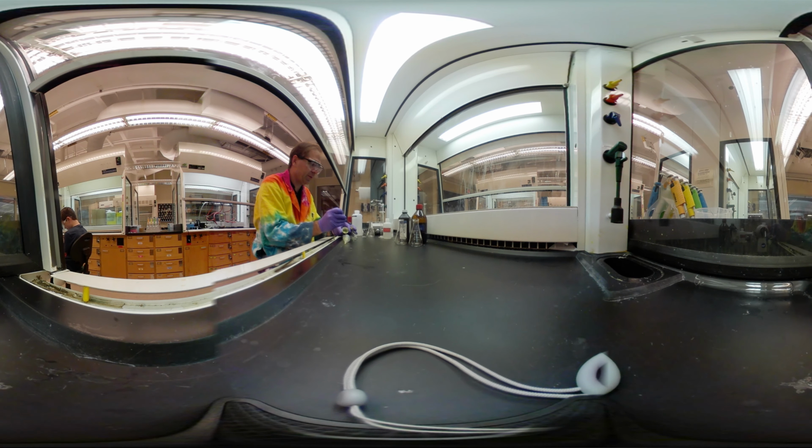Let me get out of it. Okay. And then our second one. It is a little bit gooey. I dried this for about half an hour on the vacuum filter. I wonder, given how much material I have here, it still looks like it's the right amount for a Hirsch funnel, but I think a Buchner might have worked a little better.